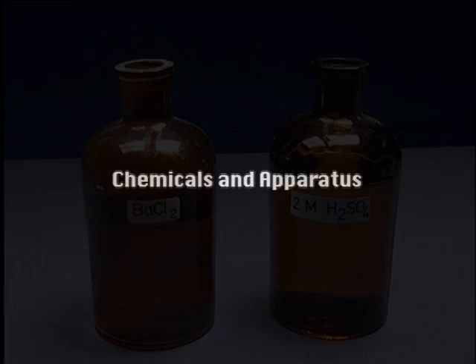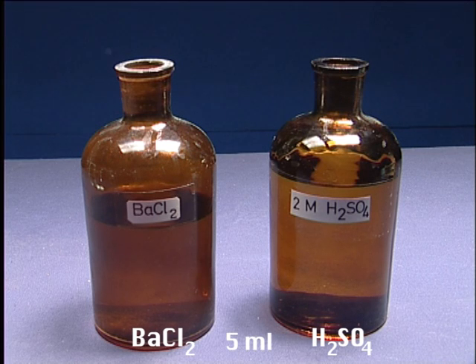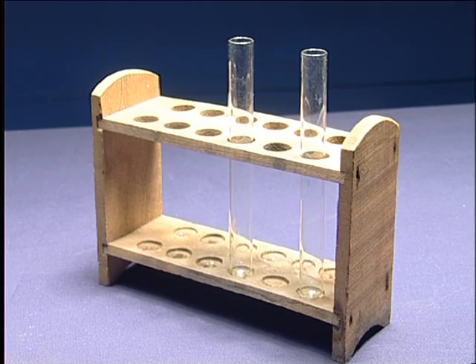Precipitation of barium sulfate. Chemicals and apparatus: barium chloride, sulfuric acid, test tubes and test tube rack.